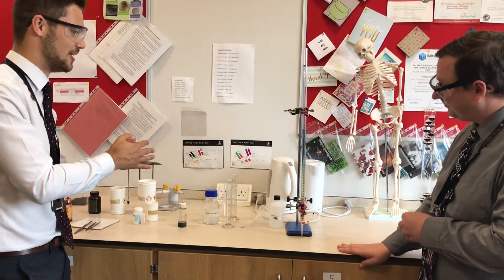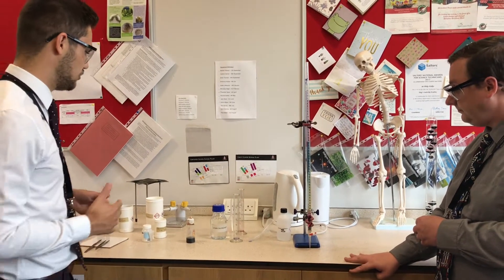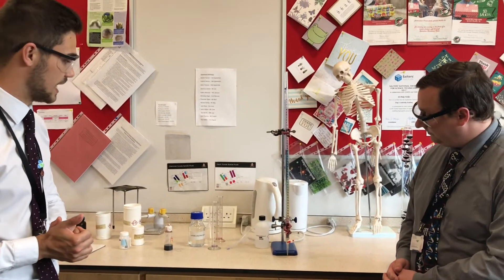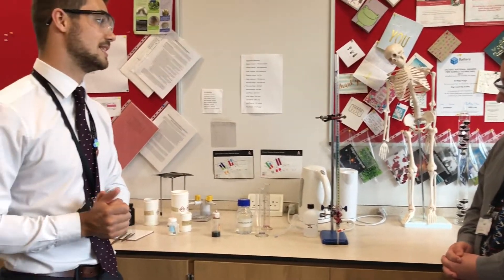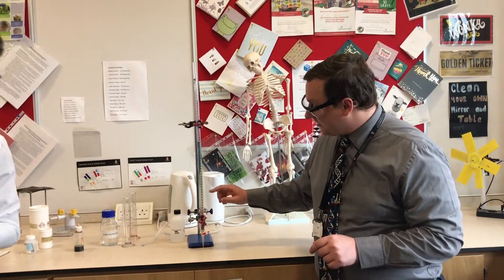So we worked out that that would probably result in complete neutralization — which it rarely does perfectly in science — but we hope that was the right amount. Whether I'm right or not, only time can tell. In the future, if I want to make this Rainbow Fizz slightly better, if I see it go red at the end I could try adding a couple of mils at a time to find the exact perfect volume. We'll come back in a few minutes' time instead of waffling on, and we'll see what colour it is at the end. Back in a moment.